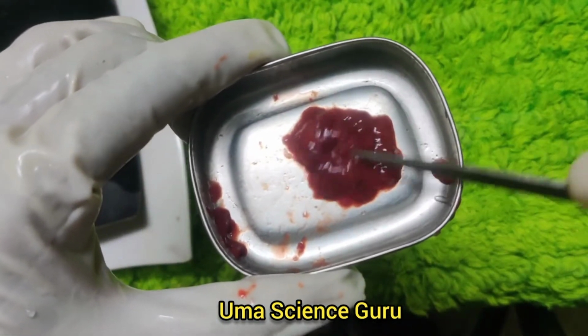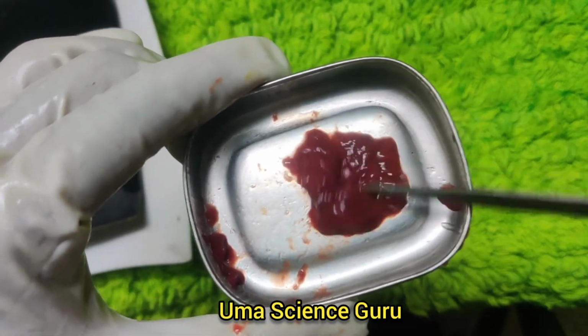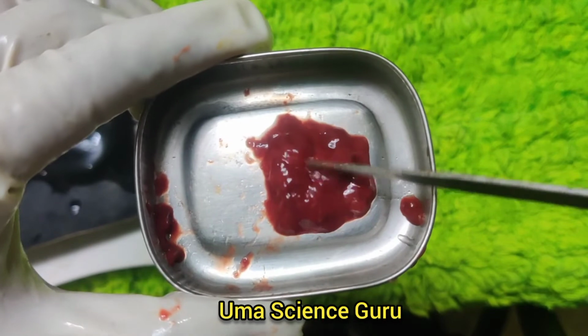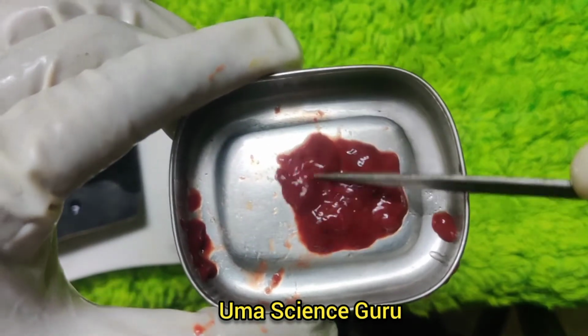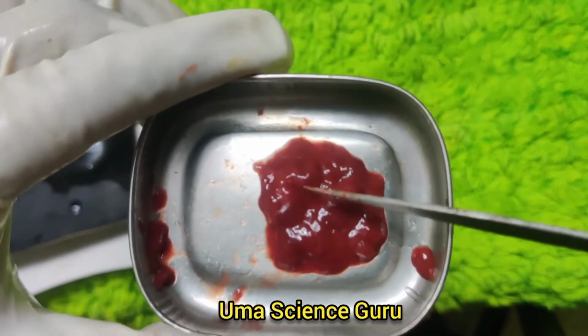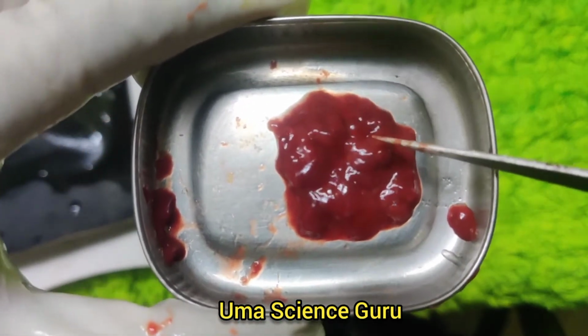This is nutrient rich sponge like tissue, storage area for minerals, particularly calcium. Osteocytes and stem cells are present in the bone marrow.